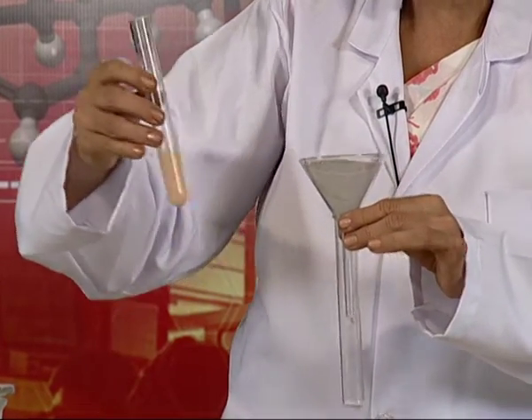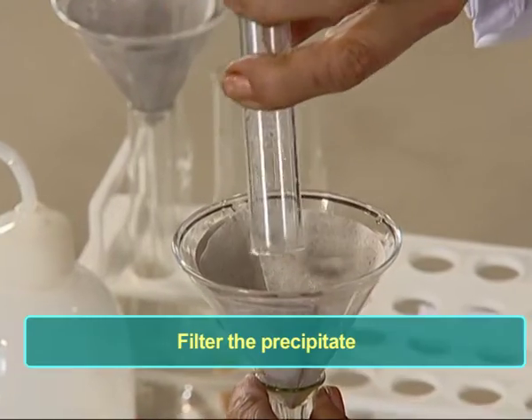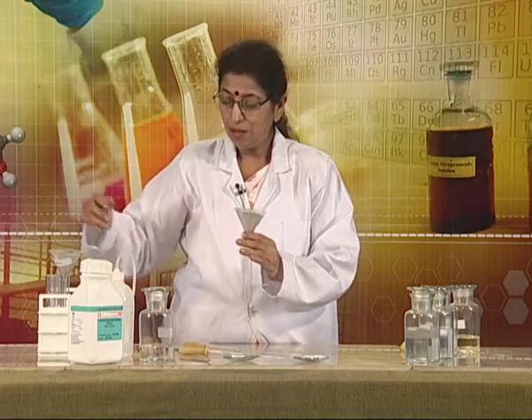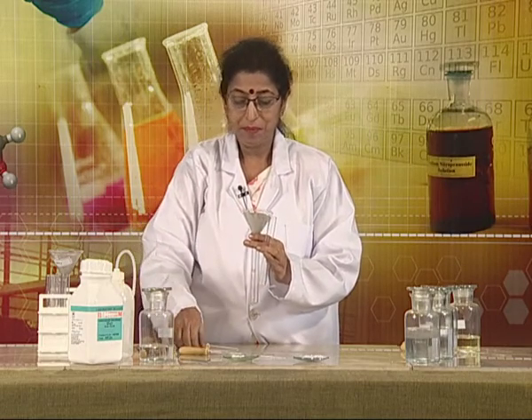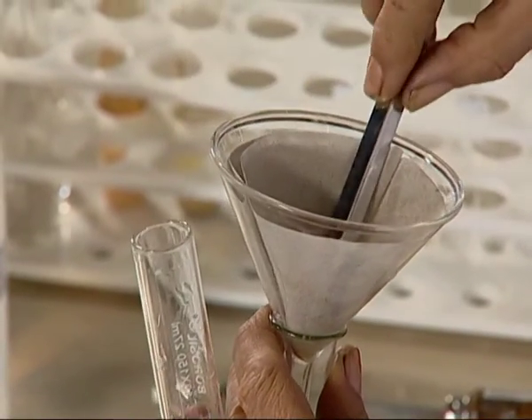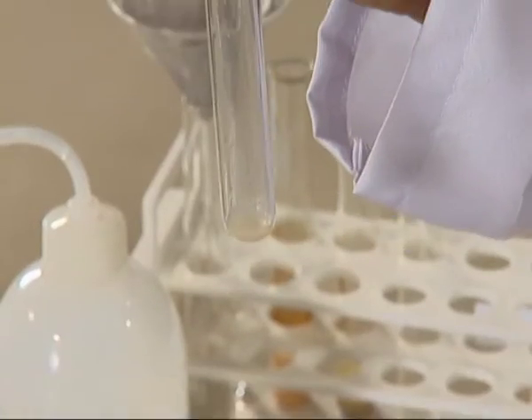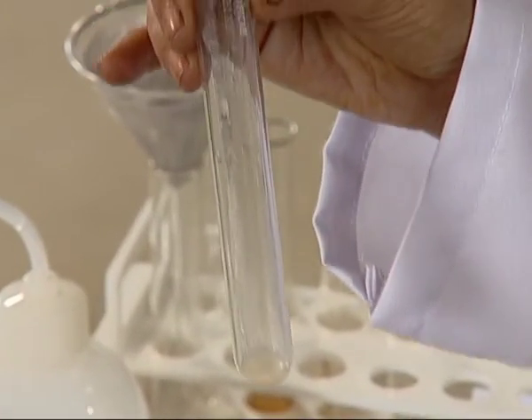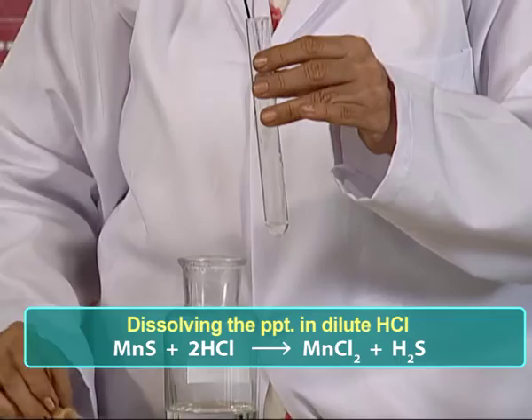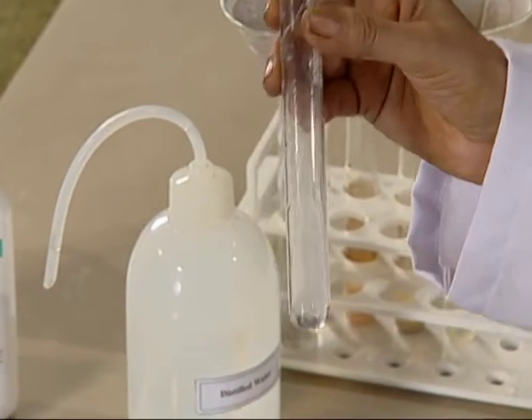Our filtration apparatus is ready. We pour the content through the funnel and let it filter. We take a little of the precipitate in another test tube. With this precipitate, we will do the confirmatory test for manganese ions. First, we dissolve this precipitate in dilute hydrochloric acid solution by adding a few drops with a dropper. The precipitate has dissolved completely.